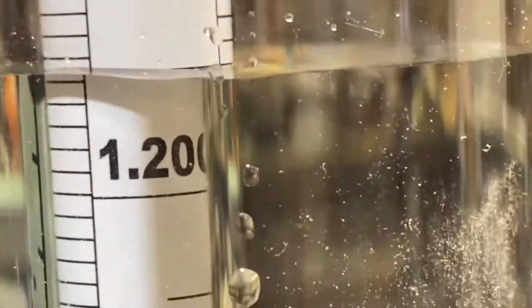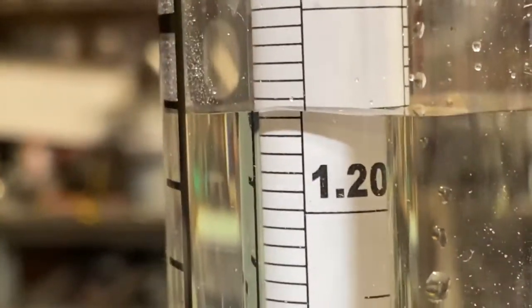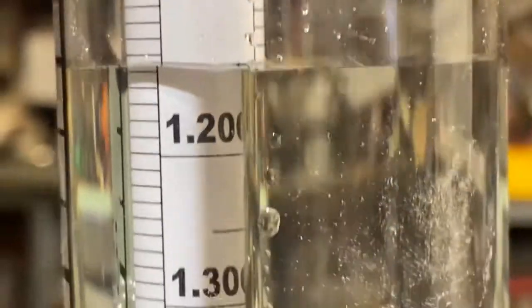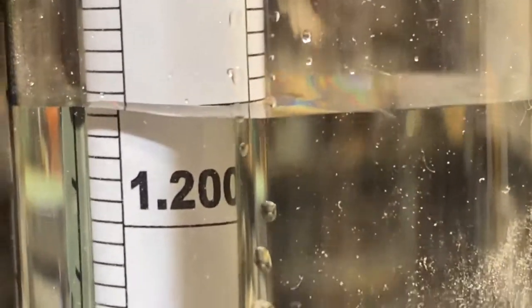There's no meniscus like last time. You see that? So it's definitely turned into some thick stuff.